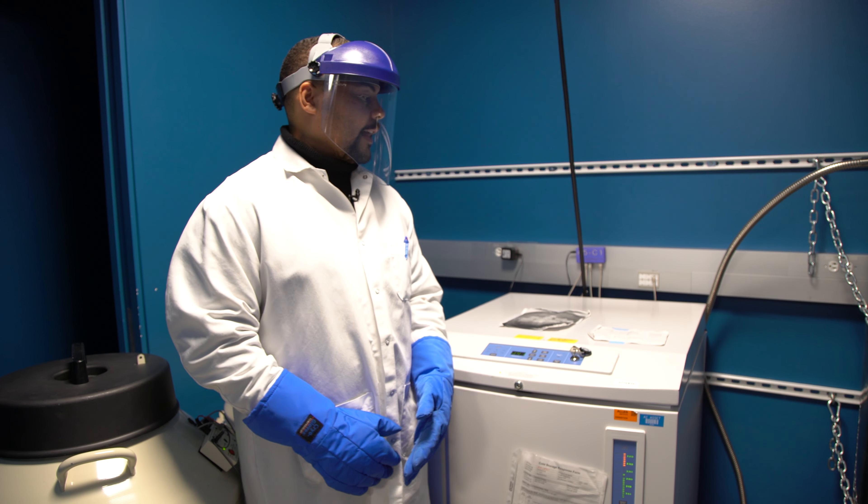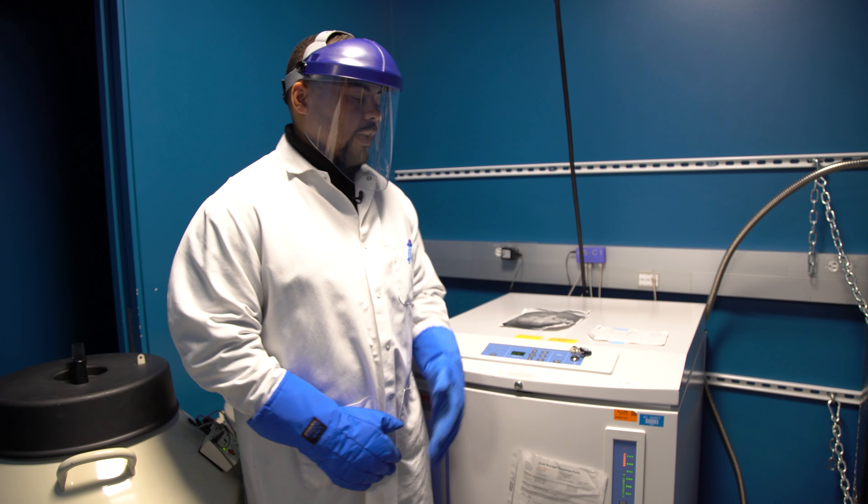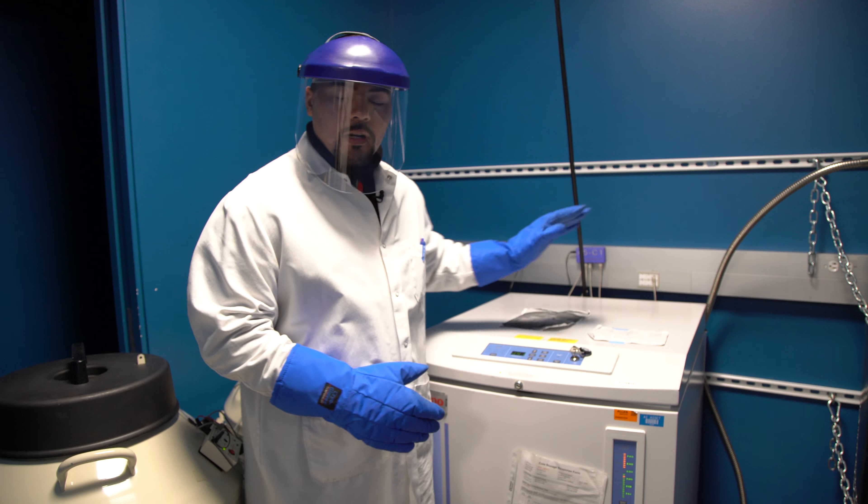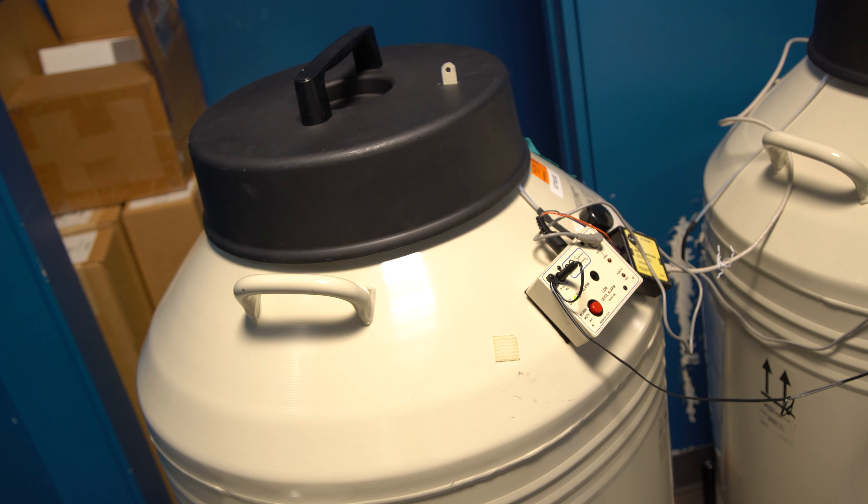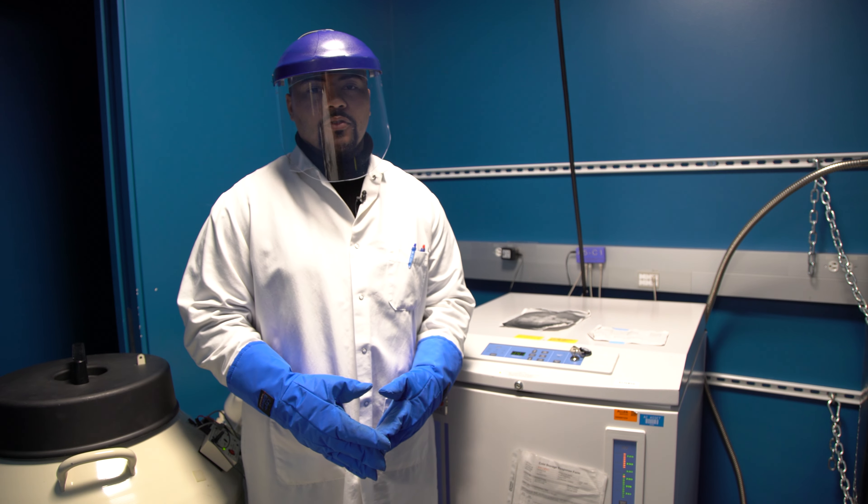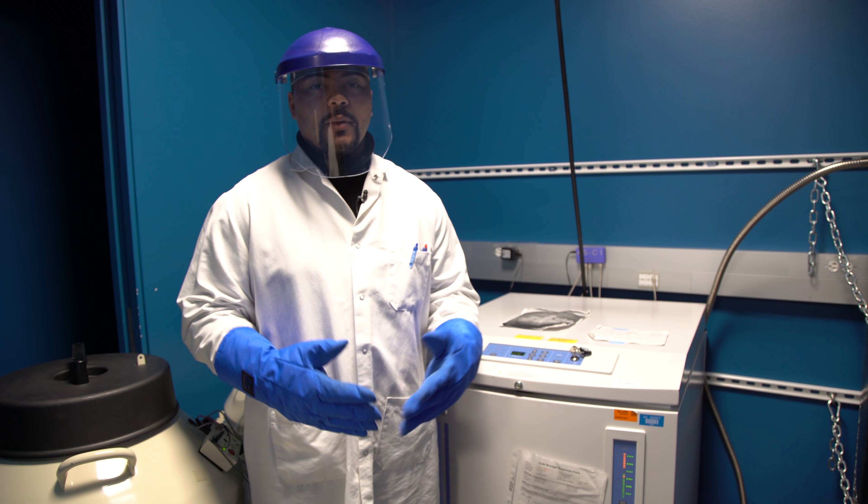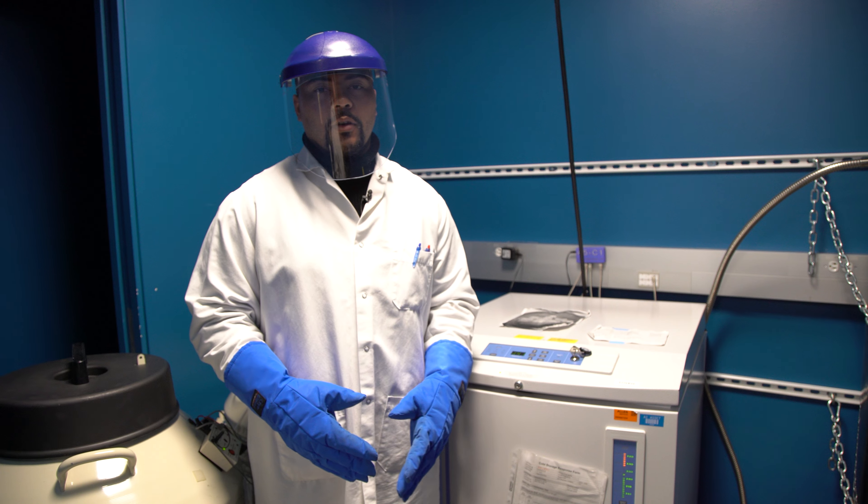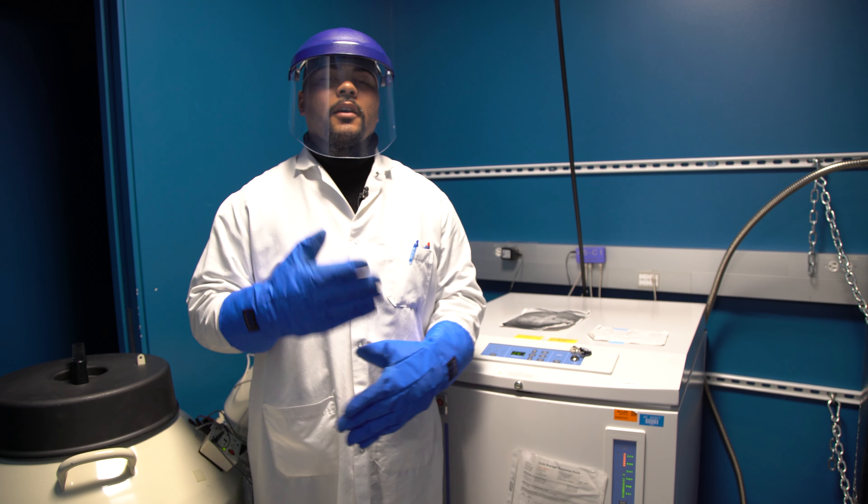Remember that these vials must be stored in a vapor phase dewar and not a liquid dewar for long-term storage. Before we go into the vapor phase dewar to grab our vials, we must make sure that we have the proper safety equipment. That includes cryo gloves and a face shield.